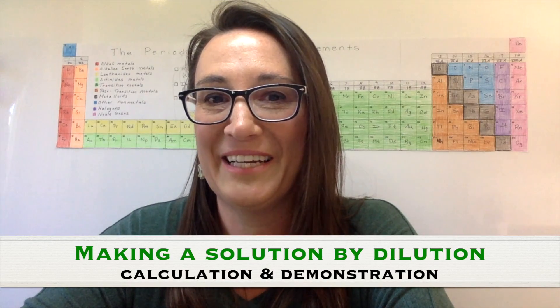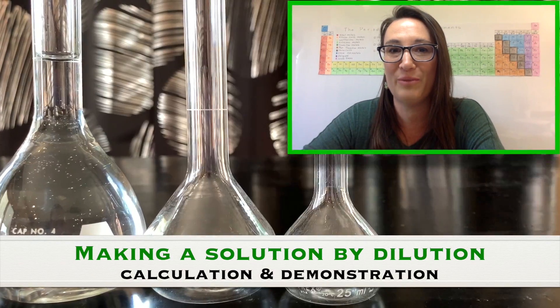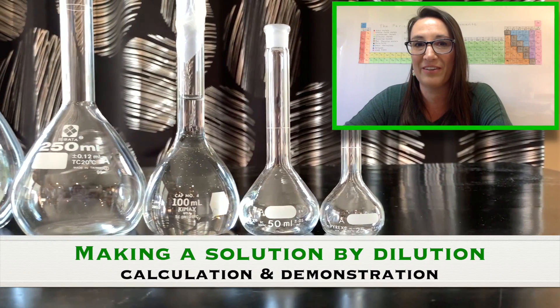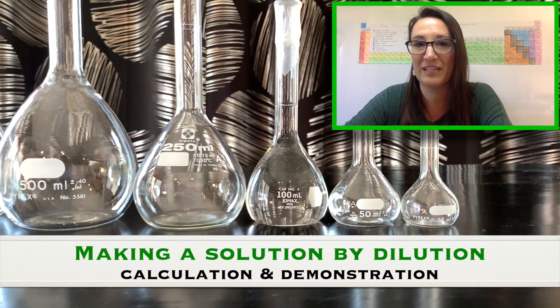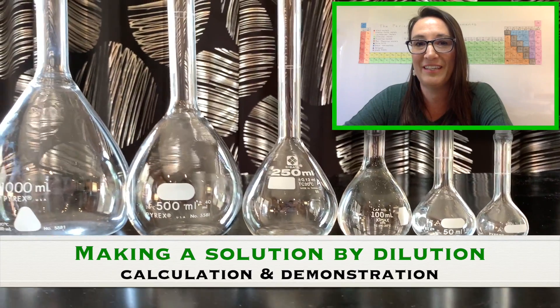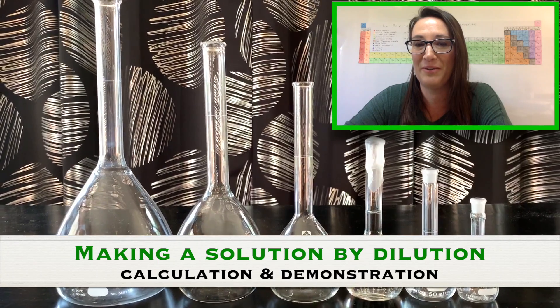Making a solution by dilution is a very common technique in chemistry. In this video, I'm going to show you two things: how to do the calculations to find what volume of your stock solution is required to make your more dilute solution, and the techniques for making that solution in the lab with the equipment you have.